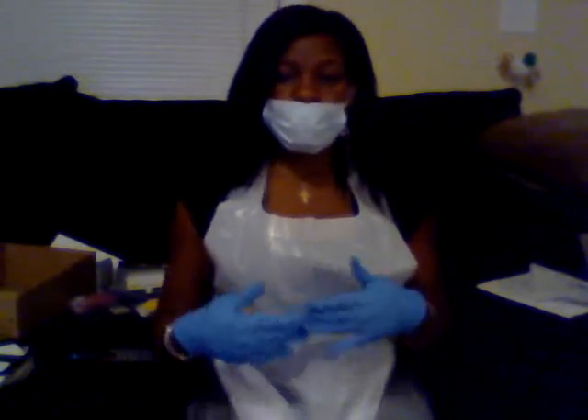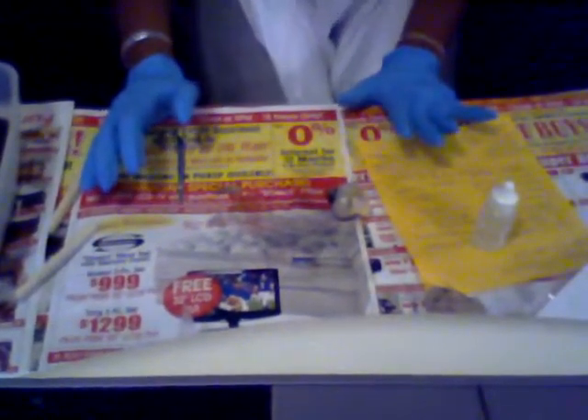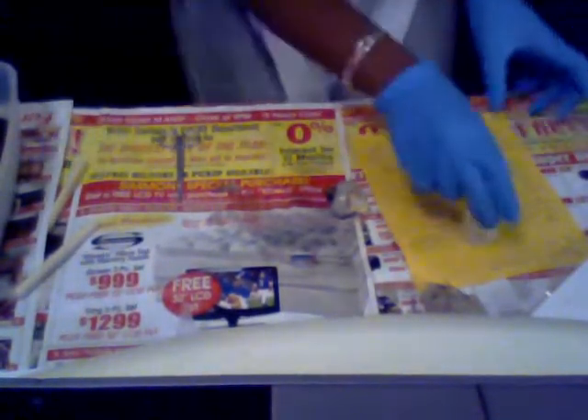You won't see me, but you'll see my hands and you'll see the eyeballs. Hopefully you can see everything. Here's my piece of paper — this is telling me the parts of the eye so I won't forget. This is telling me the parts of the eye and the parts of the brain.